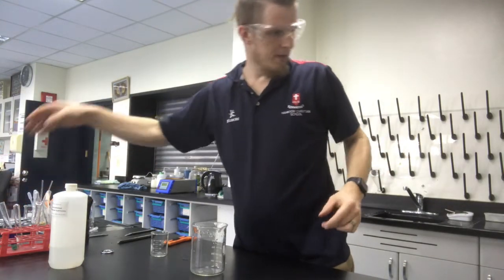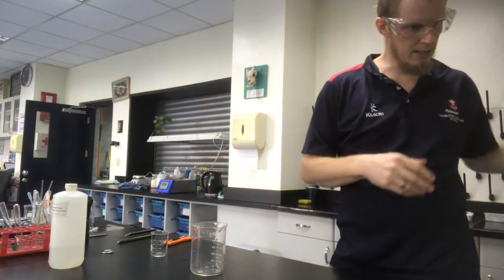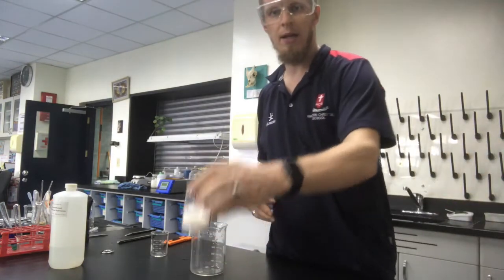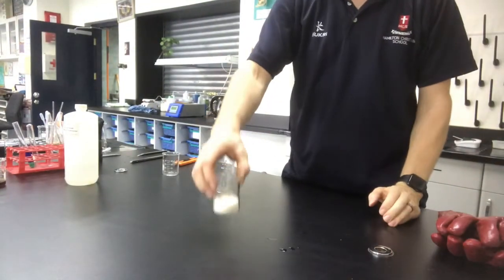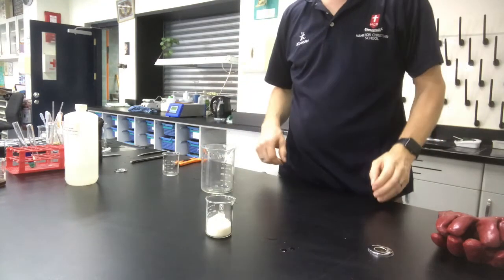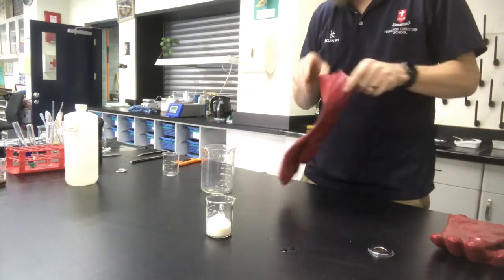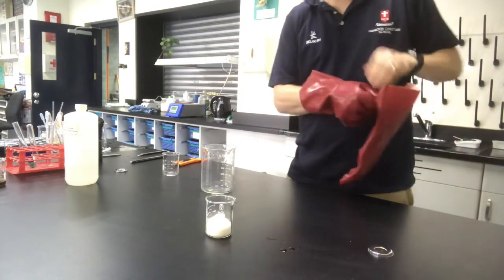Okay, the next thing we're going to do is quite a cool one. So in here, I'm just going to bring my camera angle down. In here, I've just got sugar like you would find in your house. You know, put in your coffee or your tea or whatever, put in your baking. Good old plain sugar.